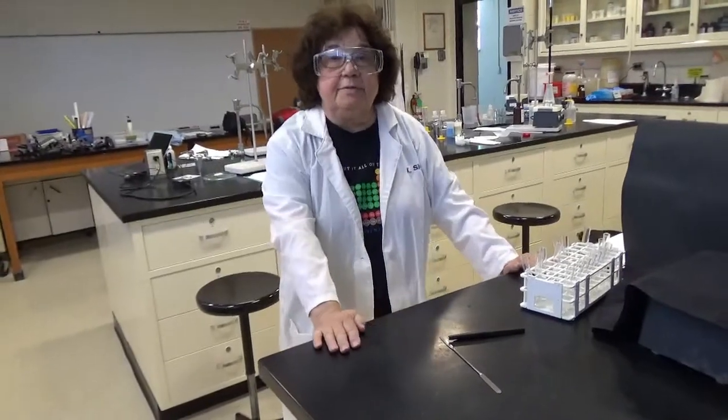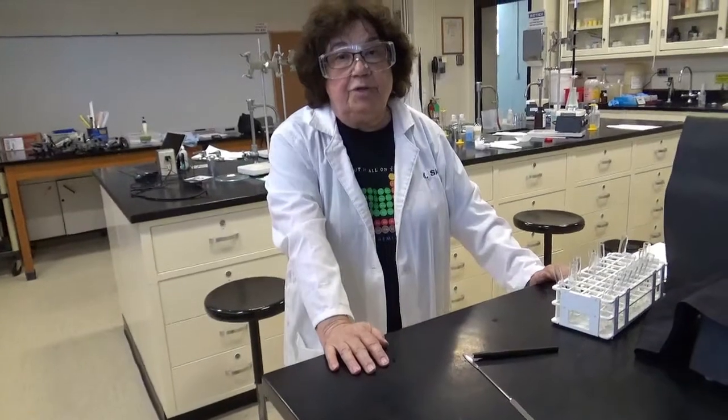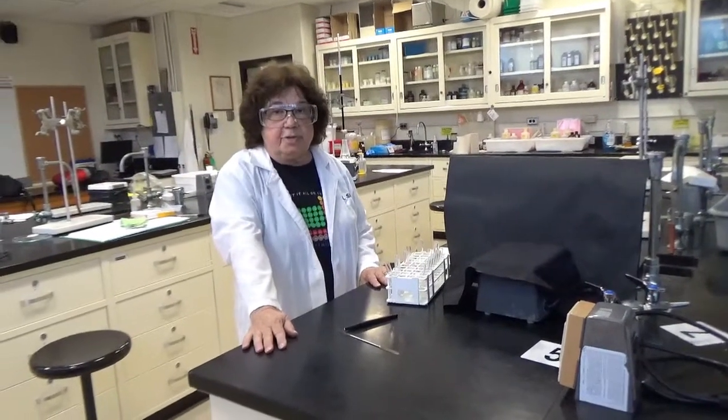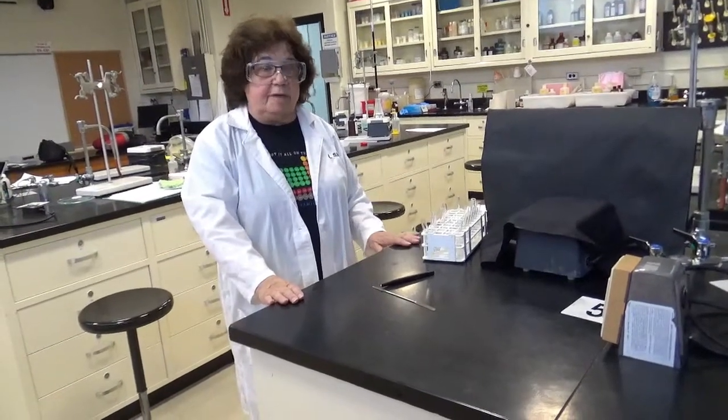So now what we're going to do is think about, number one, which materials dissolved in water and which materials dissolved in cyclohexane. And since solubility has to do with the structure of the solvent and solute, then we're going to look at the structures to see if our results make sense. Should salt dissolve in water, and why? Should vegetable oil dissolve in cyclohexane, and why?